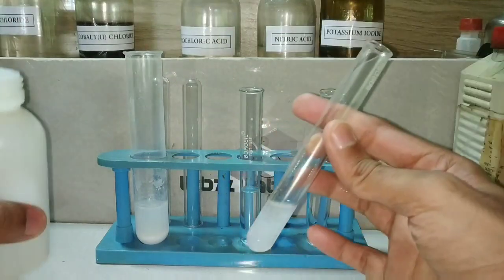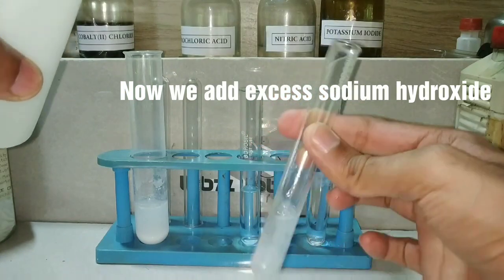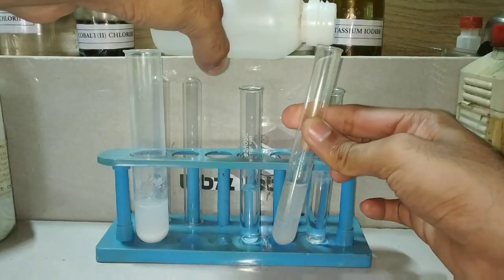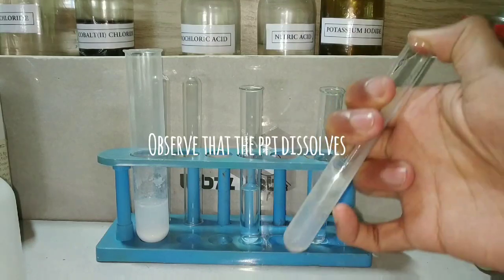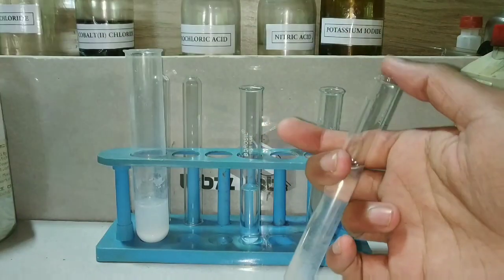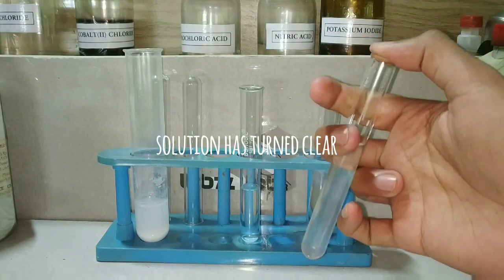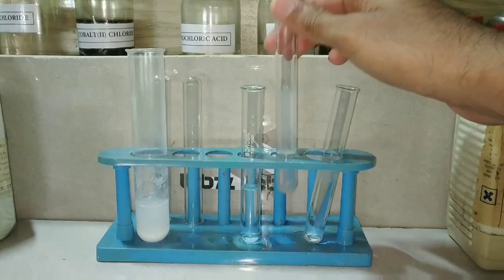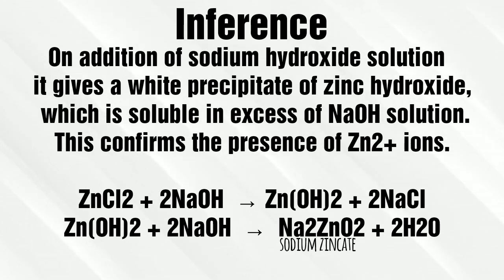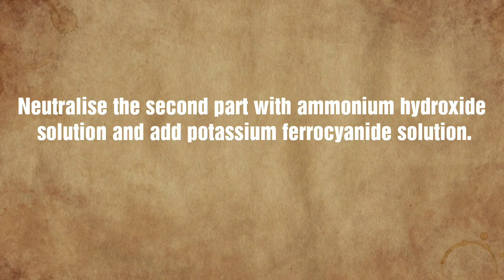We take this precipitate in another test tube and add excess sodium hydroxide. On adding excess sodium hydroxide and mixing the solution well, you can see that the precipitate has dissolved and the solution has turned clear. Sodium hydroxide reacted with the zinc salt forming the white precipitate of zinc hydroxide; on adding excess sodium hydroxide, it dissolved due to the formation of sodium zincate.